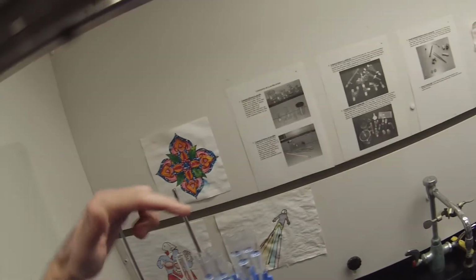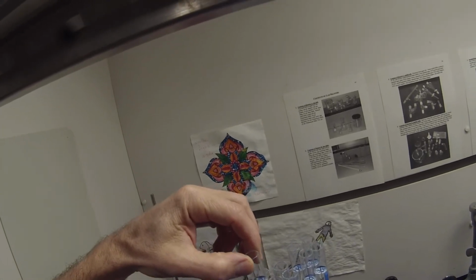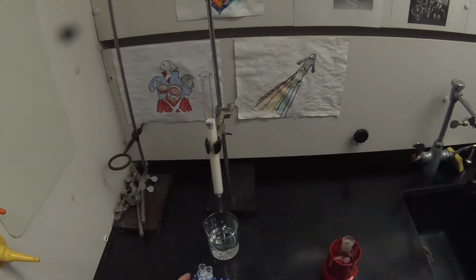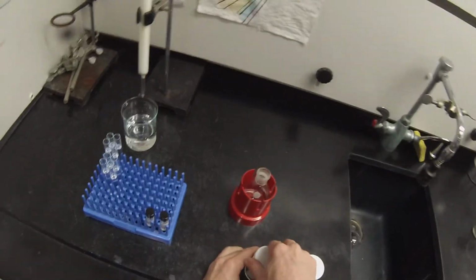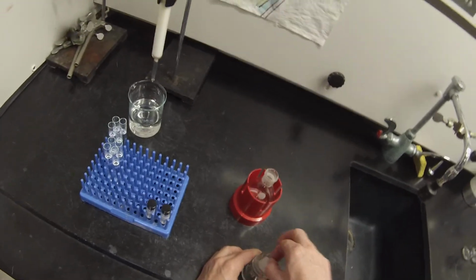There's clearly a lot of compound in these fractions because you can see that ring is very large. But then by the time you get to fraction 15, there's not a lot of compound. So my guess is we won't want 15, 16, or 17 either. That's probably good enough.